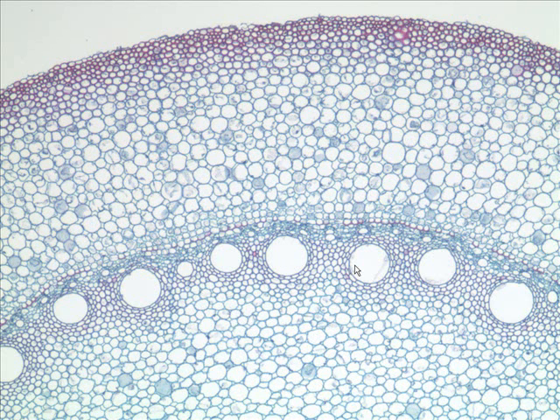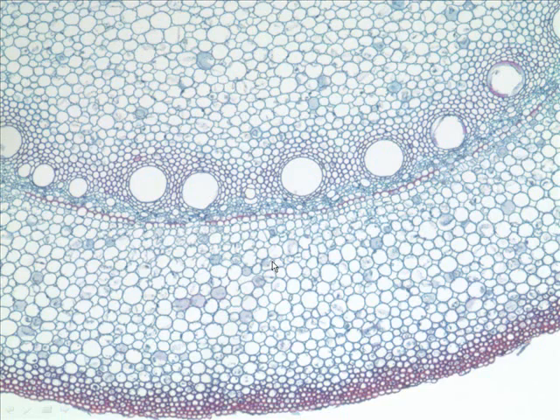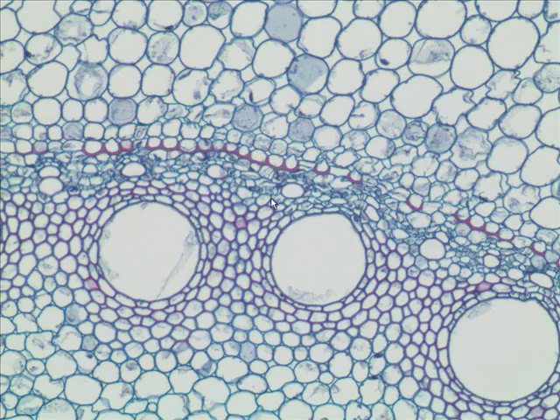All right, what are these big guys here? They are xylem. And outside the xylem, there are a couple of very important layers. And also we have some phloem in there. So let's take a closer look at that. Again, here we are in the middle. We're going to have to move past these slides. And now we're taking a closer look.